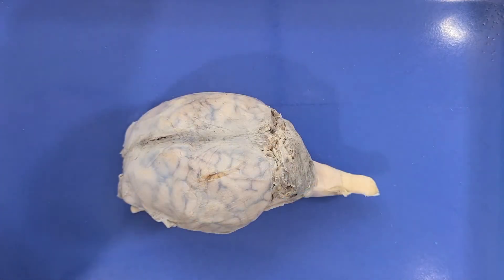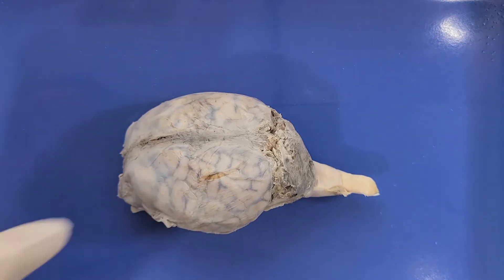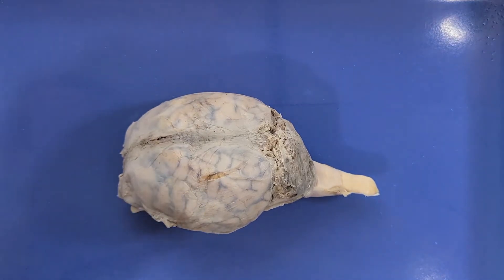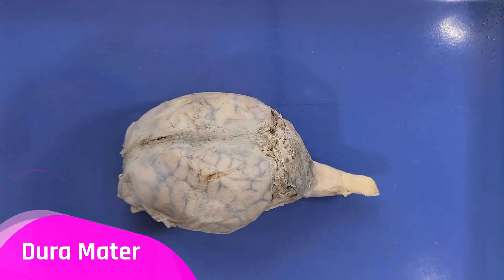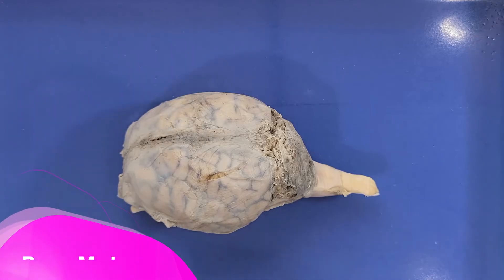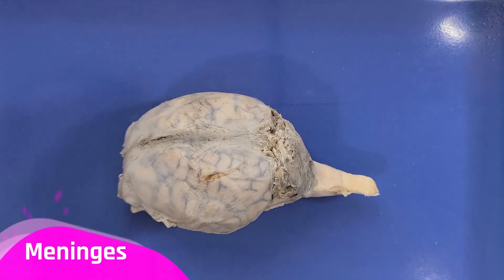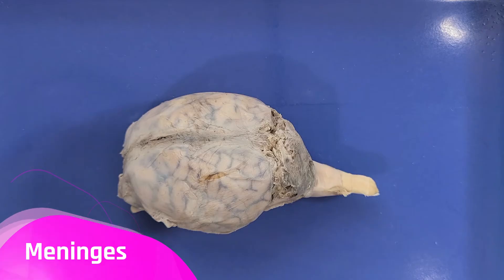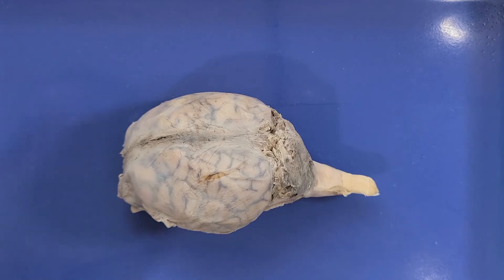The first thing we're going to have to do is get rid of this film that covers the brain. This is called the dura mater and it's the outermost layer of the three layers of membrane called the meninges that protect the brain. I'm just going to peel it off with scissors to help.